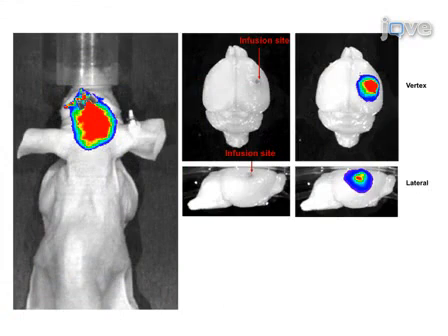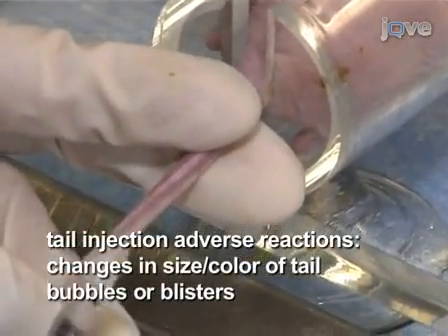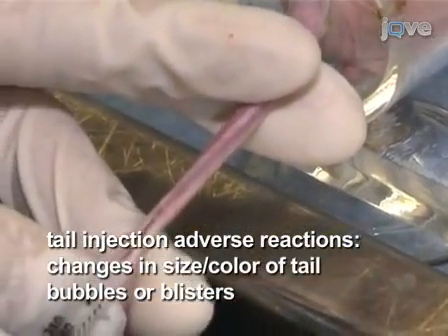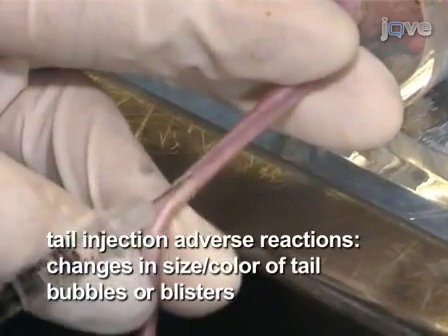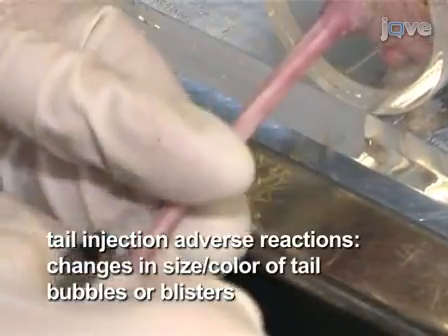For CED, a successful infusion should show most of the material in the skull near the infusion site. A lack of adverse reaction to administration of therapy is an important indicator of successful injection. The following are indicators of improper injections. For tail injections, change in the appearance of size or colour of the tail, a bubble or blister in the tail indicating subcutaneous rather than intravenous delivery.